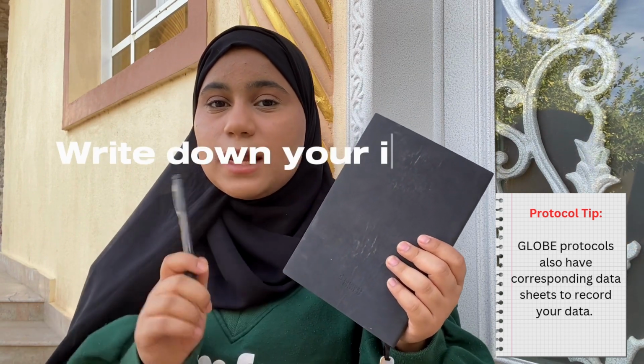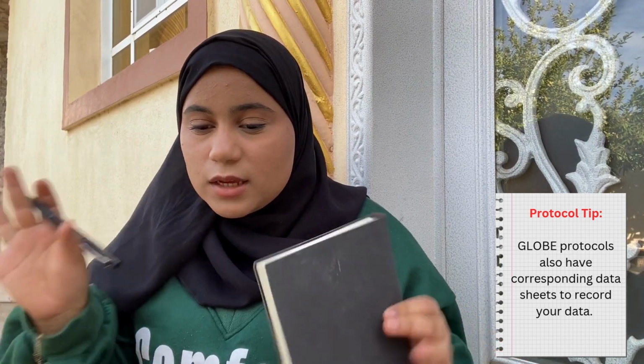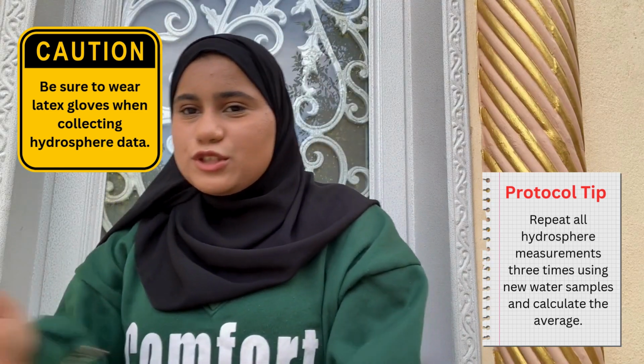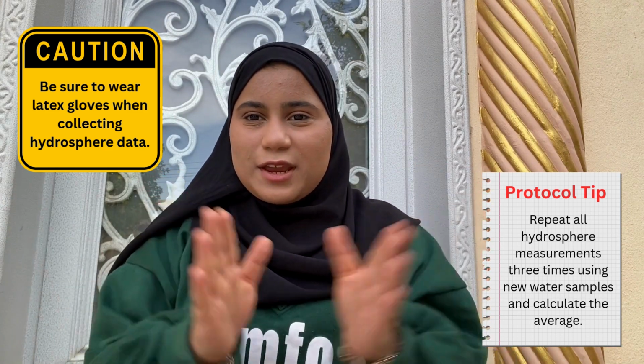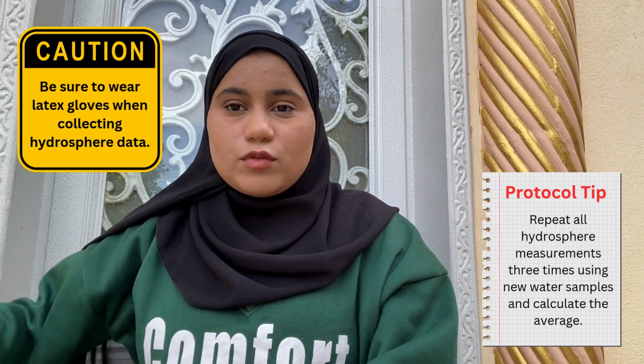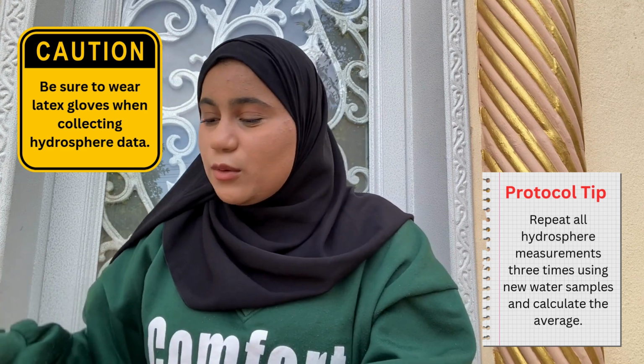I am so excited. Before we actually start the whole thing, the first thing we need to do is get a notebook and a pencil to write down every single piece of information, every single number that we get, because we want this information with us if we want to use it later or compare it with something else. After getting our first step done, which is getting our notebook ready, I kind of changed the camera. So the notebook is ready to write the information on it. Let's get started with each and every single one of the things we're going to do today.